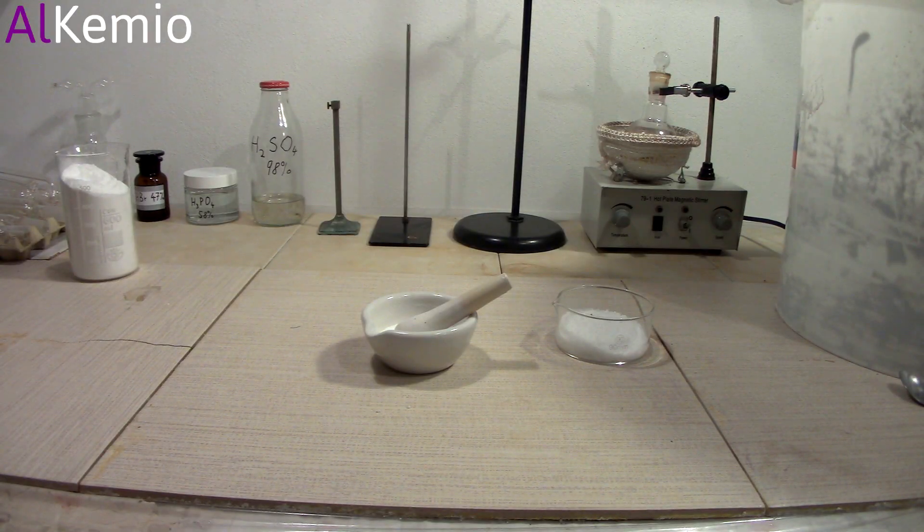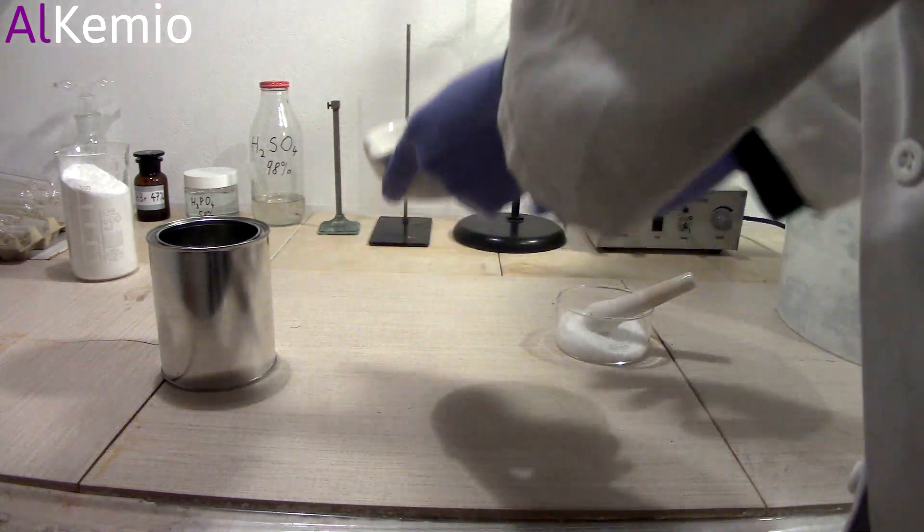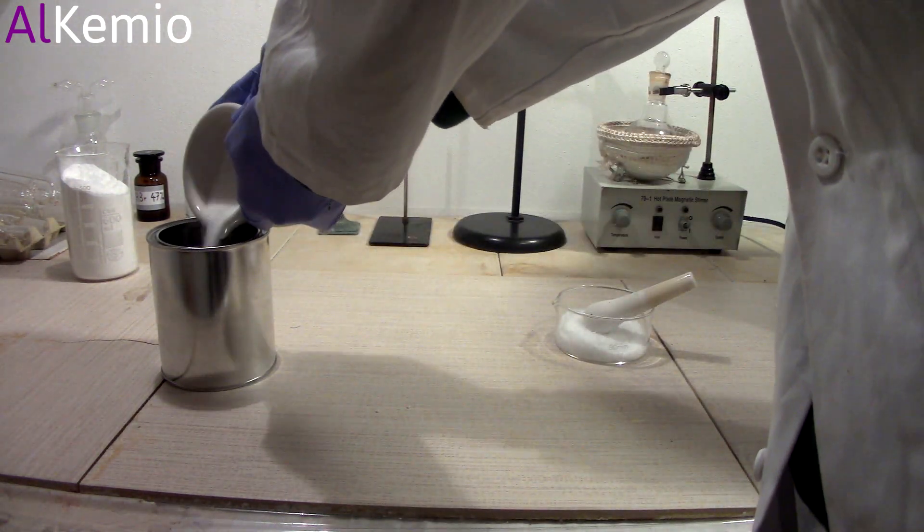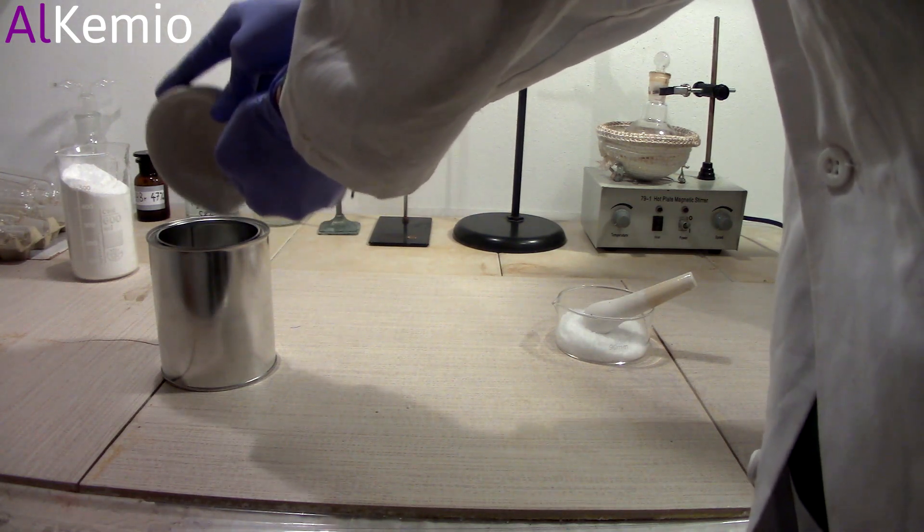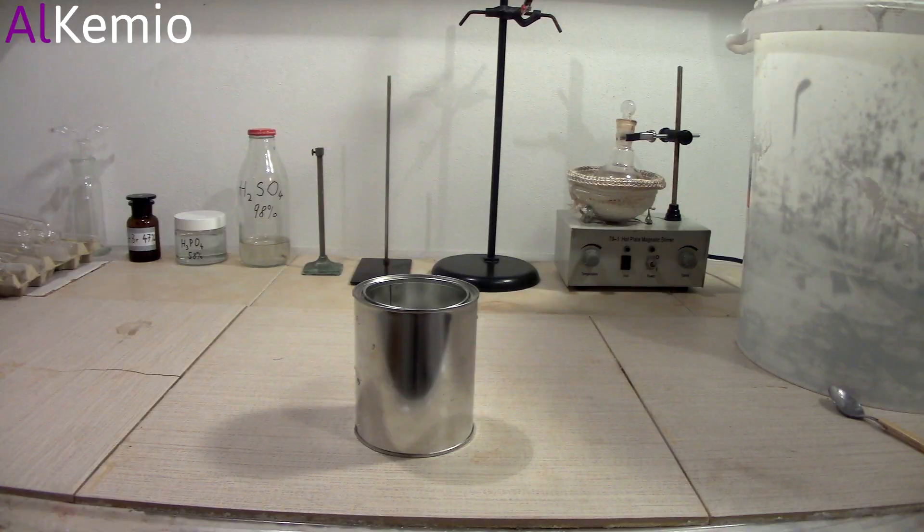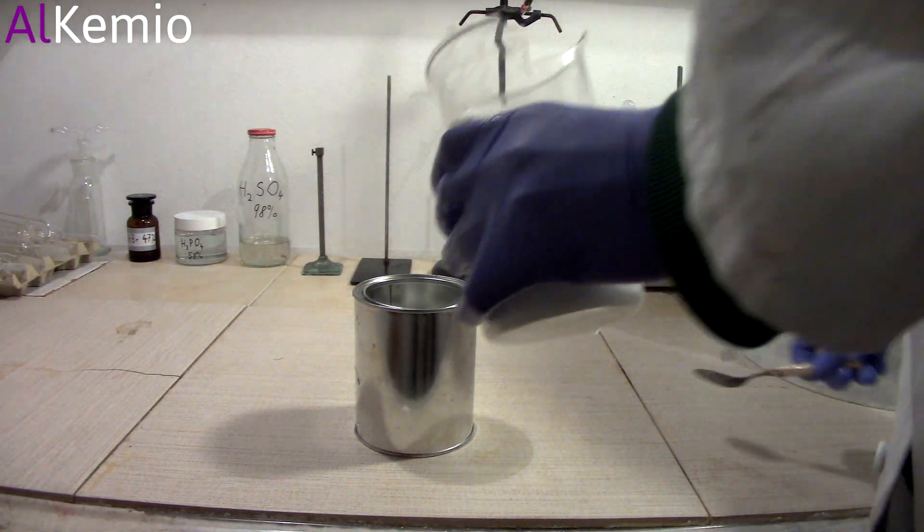Next, I put all of the sodium hydroxide in the can where decarboxylation reaction will be proceeding. Now I will transfer sodium benzoate into the same can.